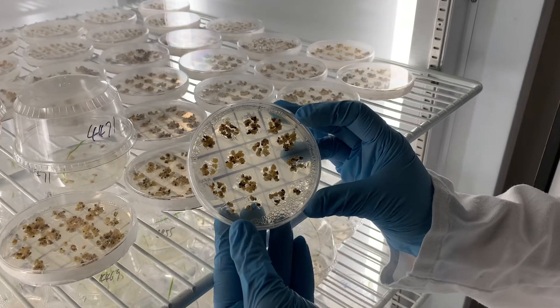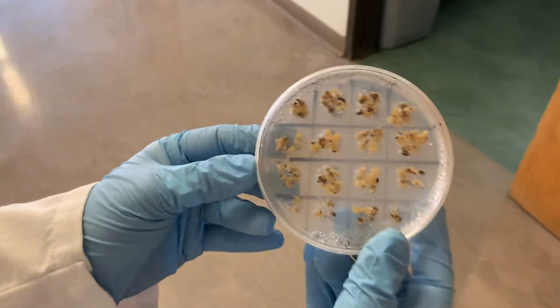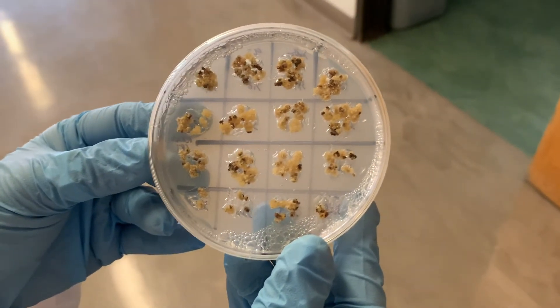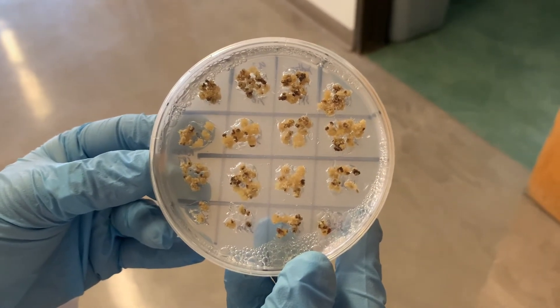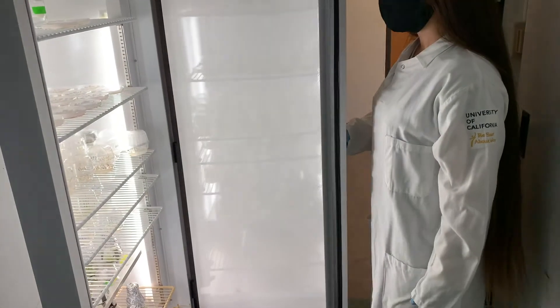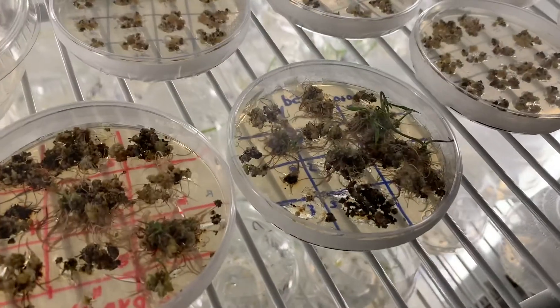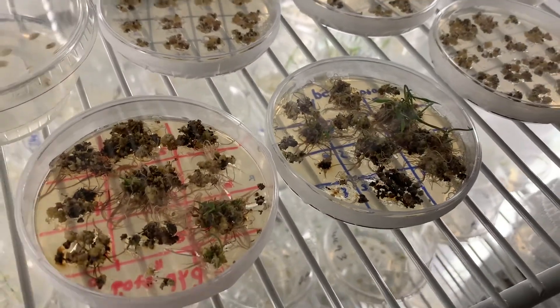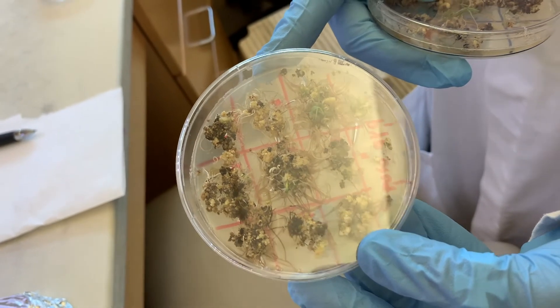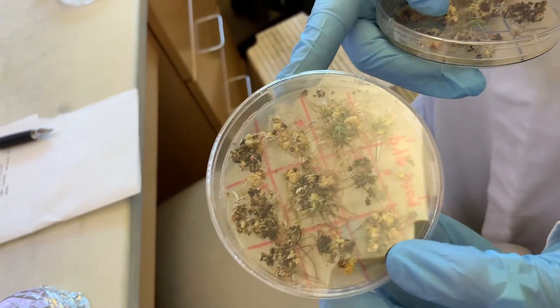After 10 days on the selection medium, not all of our calli have survived. Notice that some of the calli turn brownish while others remain creamish. The creamish-colored calli are the ones that remain active and alive, and they will be subsequently transferred to fresh selection media. We'll do this at least two more times, allowing the positive calli to keep growing.